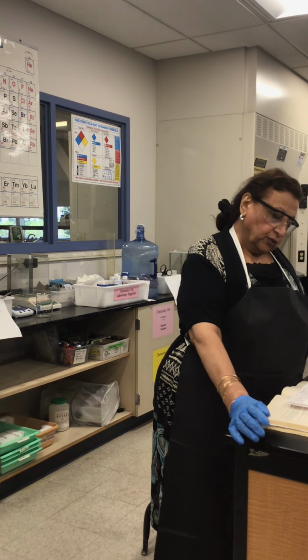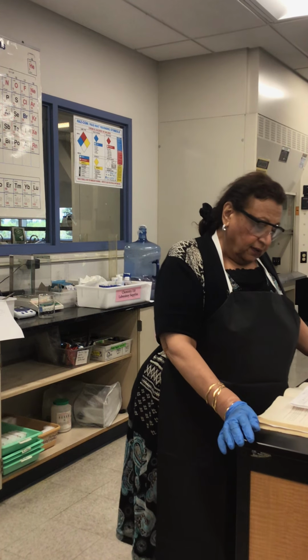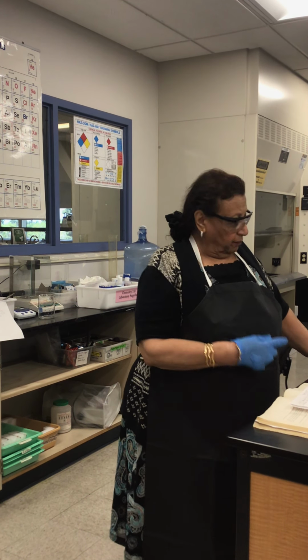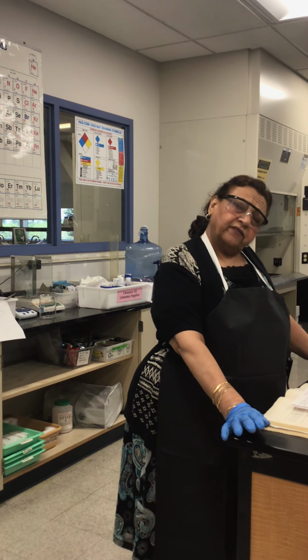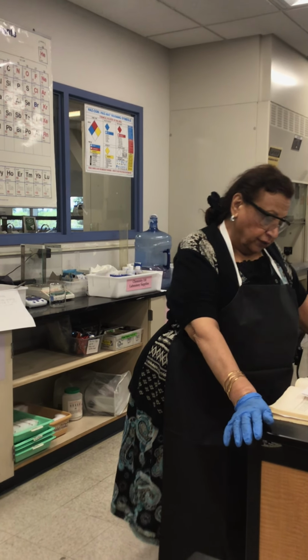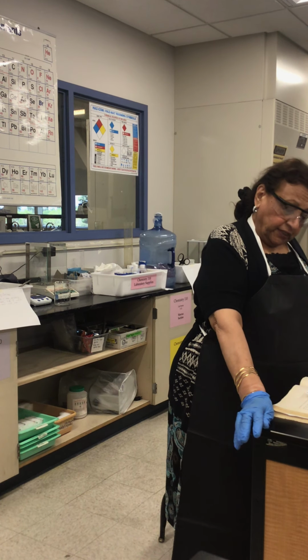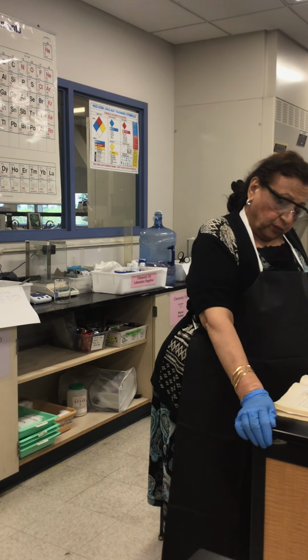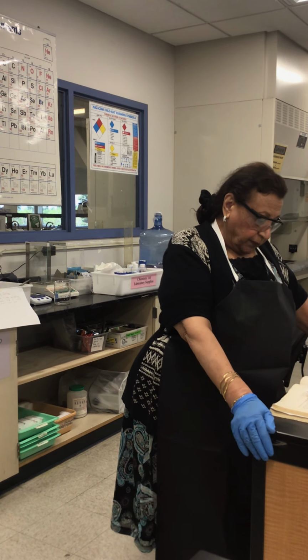We are going to use the capillary method by heating the sample and recording the melting points, and then we'll draw the curve. What is the advantage of the cooling curve? It is to determine the amount of impurities and determine the depression caused by the impurities.